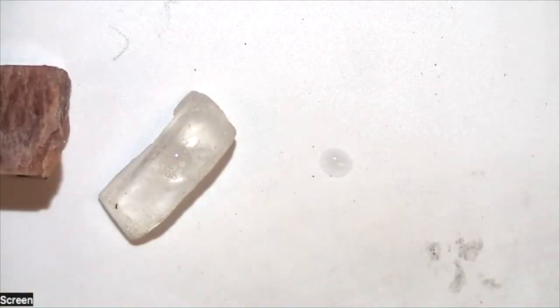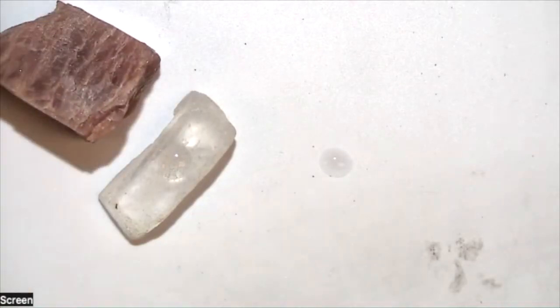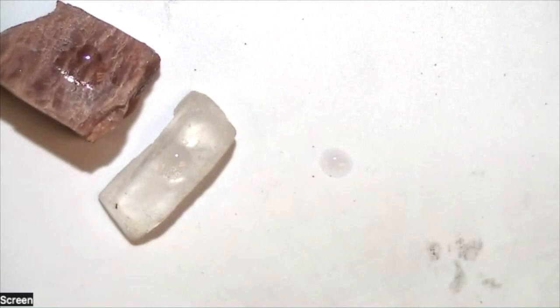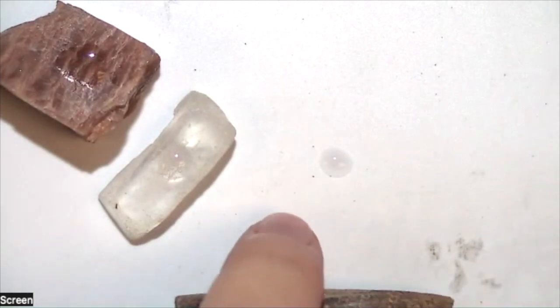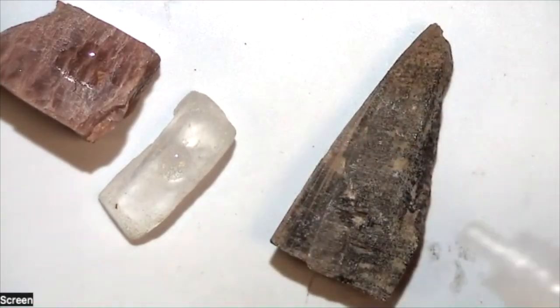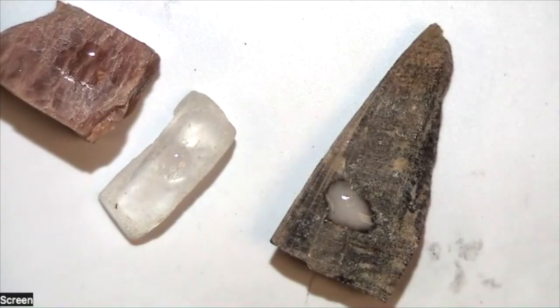Here's a different mineral that some people might confuse with calcite that has coloration. If I put a little bit of hydrochloric acid on there, you can again see not much is happening at that level. Sometimes you'll have something like a fossil. Fossils contain a lot of calcite typically, so if I put some on here, you can again see a lot of fizzing. It's in fact easier on that because it's an opaque surface, so you can see those bubbles rise up. So that's really how you use hydrochloric acid.